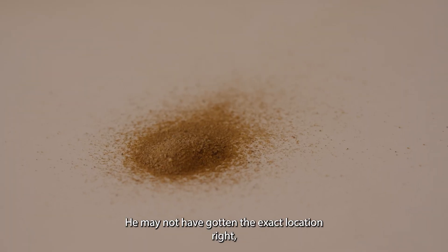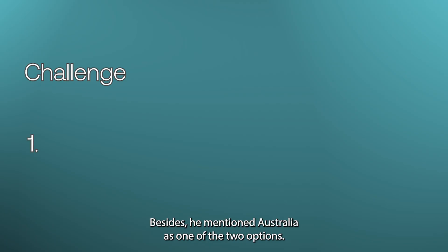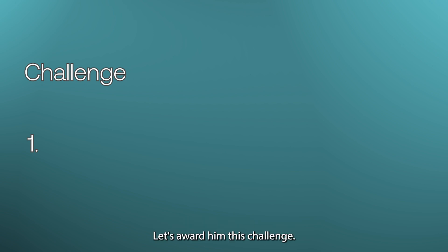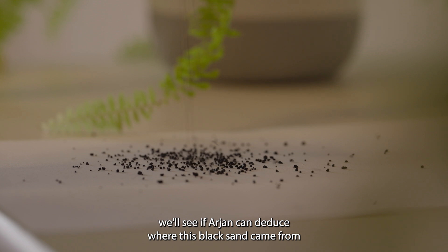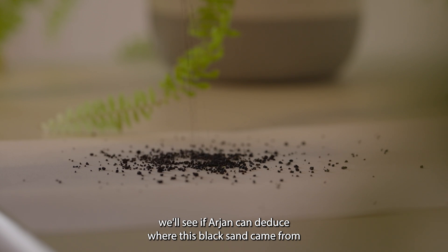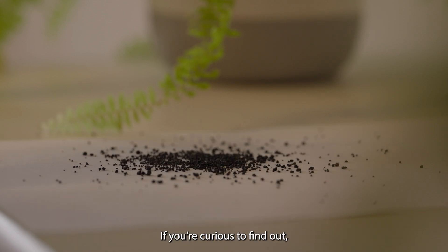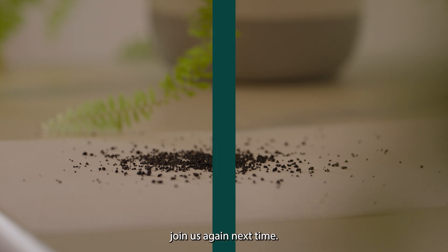He may not have gotten the exact location right, but his analysis of the diffractogram was spot on. Besides, he mentioned Australia as one of the two options — let's award him this challenge. Next time, we'll see if Arjan can deduce where this black sand came from based on its diffractogram only. If you're curious to find out, join us again next time.